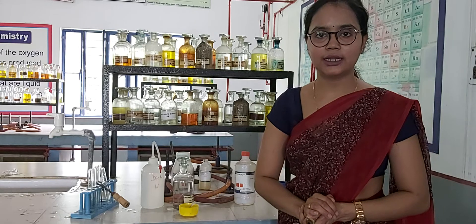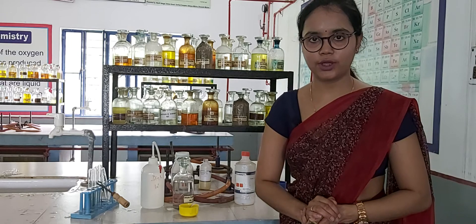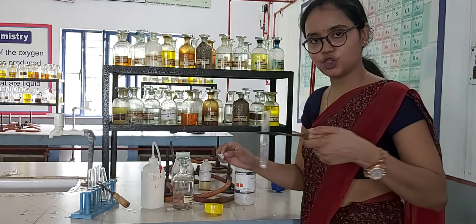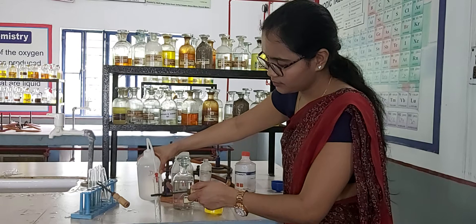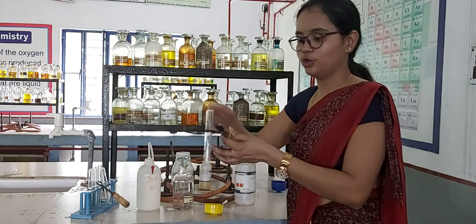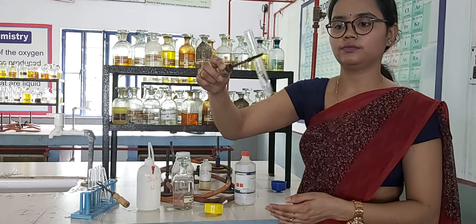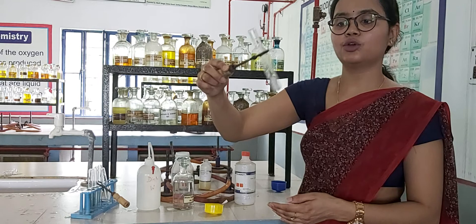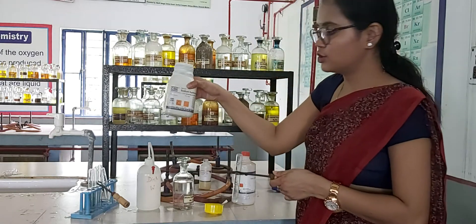For the detection of the basic radical, we will start our practical from zero group. For the detection of zero group, you will take a small quantity of the given salt in a clean test tube, then add distilled water to it and make a solution. After dissolution of the salt, you will add sodium hydroxide solution.